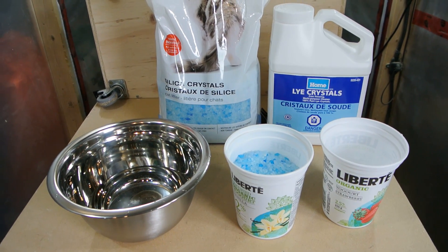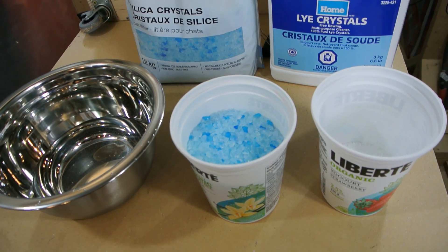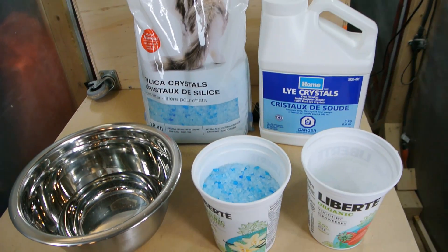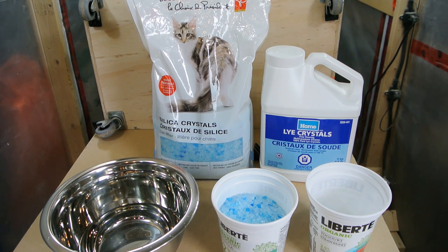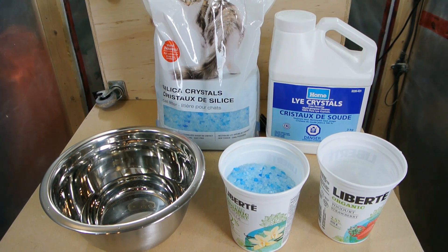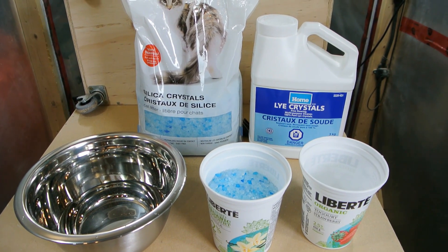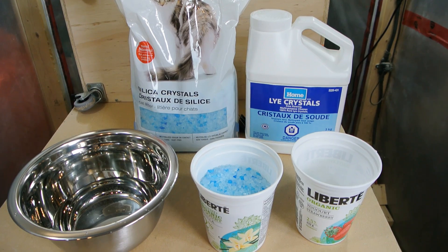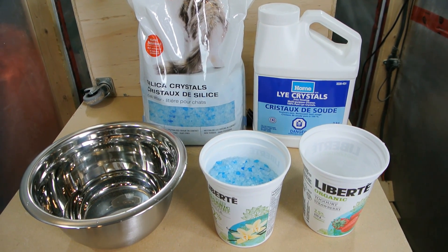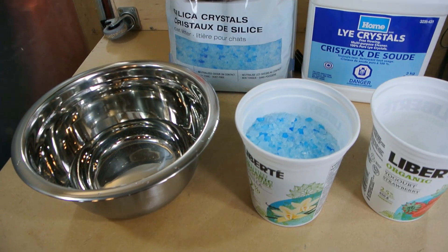How do you make this stuff? Well, I couldn't buy it so I have to make it. I couldn't find a place locally to buy it - I tried all the hardware stores, I tried in the industrial park. No one seems to really carry it anymore. They carry a lower concentration grade of water glass for sealing concrete floors, but I need something that's a little more concentrated.